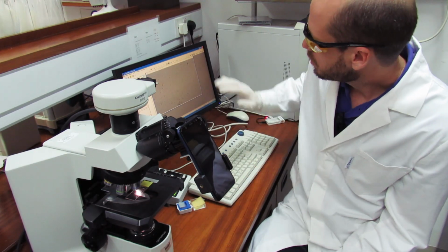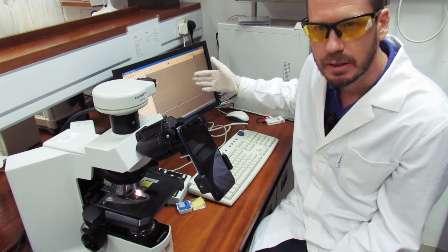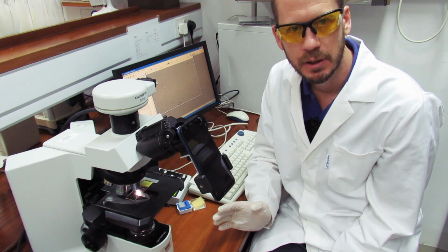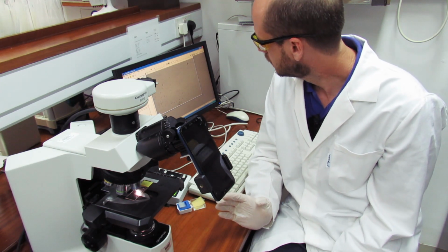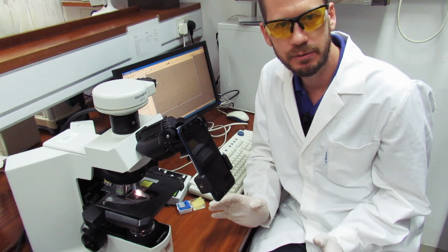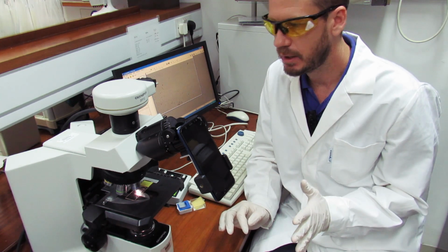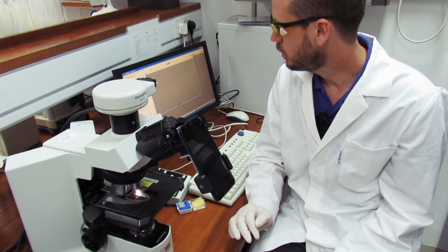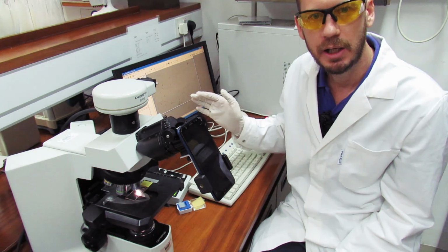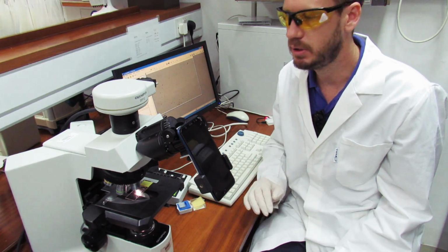This microscope, of course, is connected to the computer, and the computer has software where you can see the microbe slide with some bacteria. There's no preparation for these bacteria at all. It's not fixed, not stained, just looking at what we see here. On the screen, you can see this is 40 times magnification. And I'm going to show you the whole procedure of the basic operation of a microscope in general. Okay?